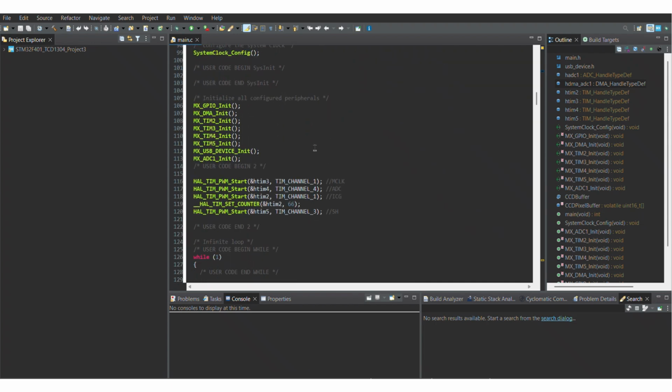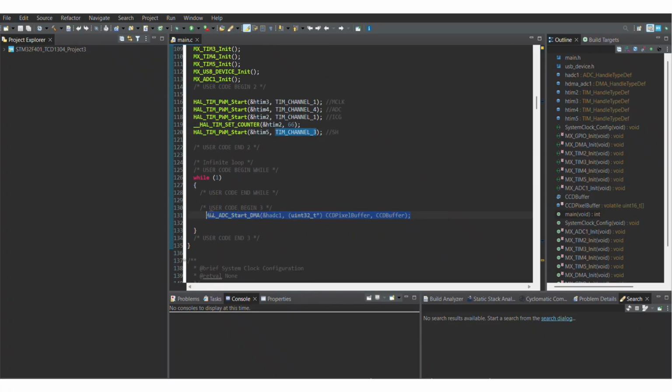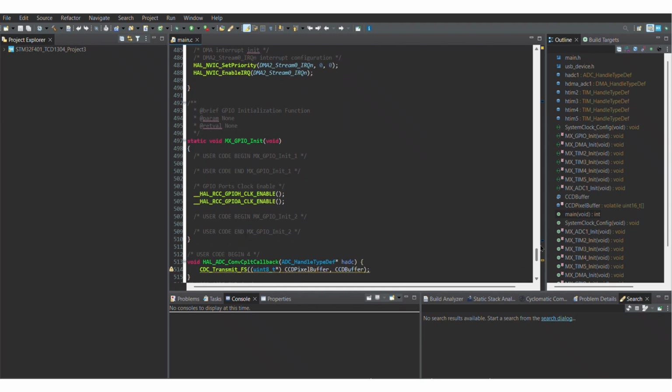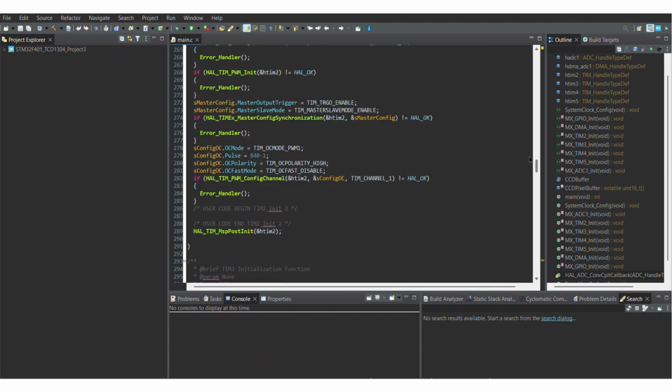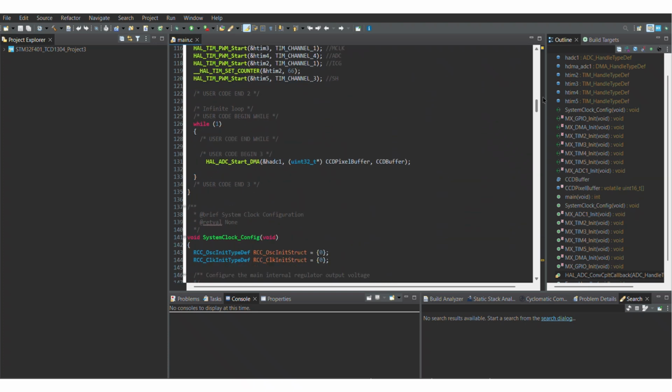Here we have the initialization of all peripherals used, as well as the start of the 4 timers and the delay used before the shift gate has begun. Here we have the while loop, which is the command that begins to send the data. And if we scroll down here, you can see what is being called within the while loop. This transmits the data using the VCP connection over the USB cord. So again, that's here in the while loop, which will send all the data.